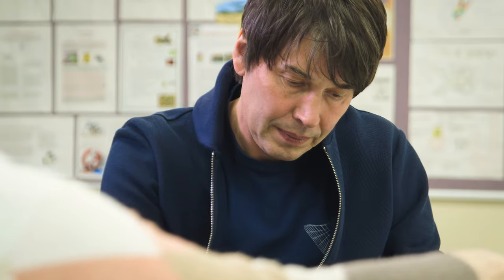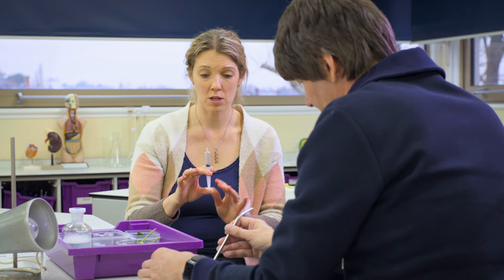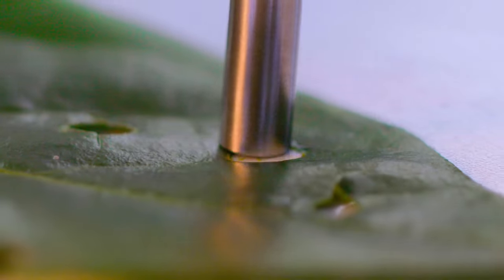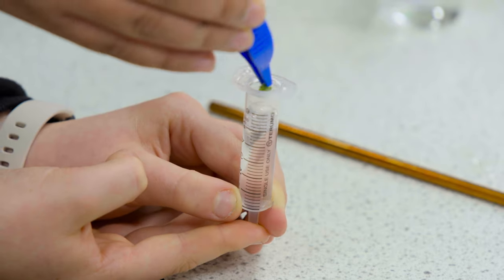When you're doing the practical and pushing the air out, make sure your students have goggles on because you don't want to be squirting sodium hydrogen carbonate solution into your eyes. Otherwise it's not going to hurt you, but it's better to have the safety goggles on. Forceps would also be good to use.